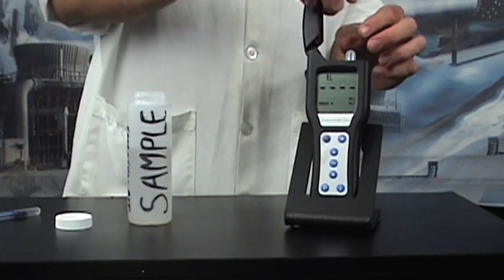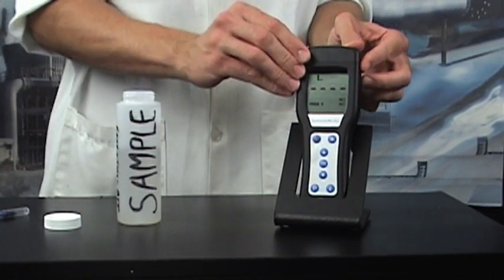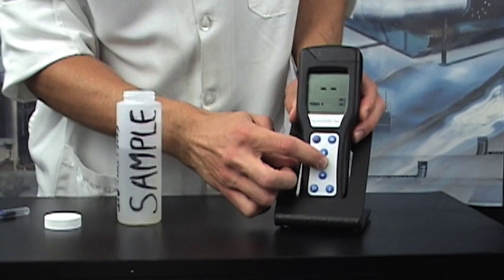Insert the ATP pen into the meter and press OK. The test takes 15 seconds to complete.